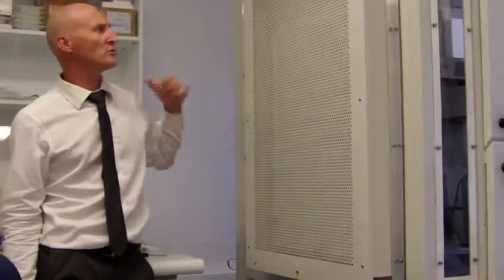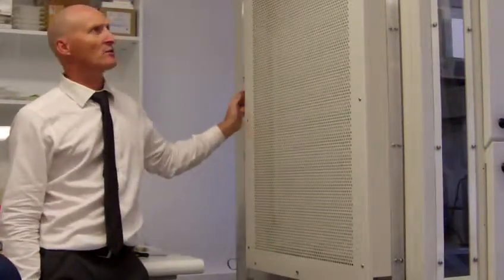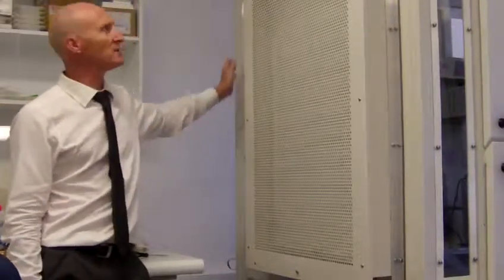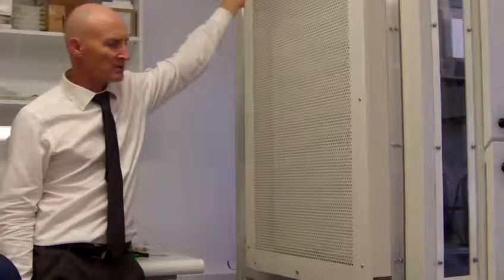We chose to mount it on the side because we had plenty of space. It wasn't going to interfere with anything, and so we chose this point. If you choose a different opening to put it into, you just need to obviously modify the amounts of aluminium bracketing and everything else that you need in order to get it mounted.